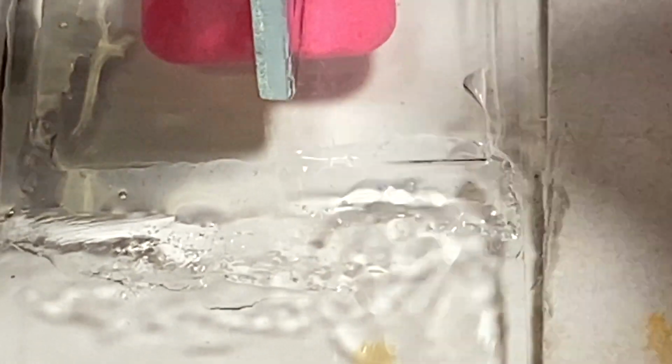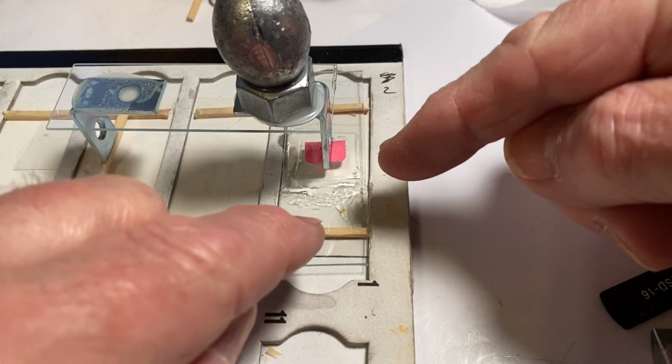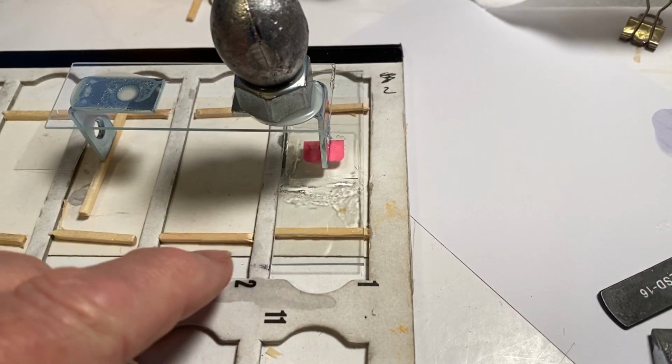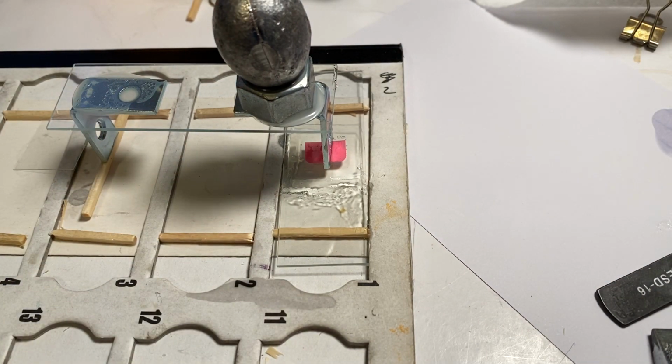That's right. Like that. And if you noticed, the reason I have these matchsticks here is because what happens a lot of times is the mounting medium will go around the side of the slide underneath it and stick the slide to your table. So this can go around underneath and it won't stick to the table. You know what I mean? So just, it's one thing that I learned. Anyway, I think that's about as much as I want to show you.